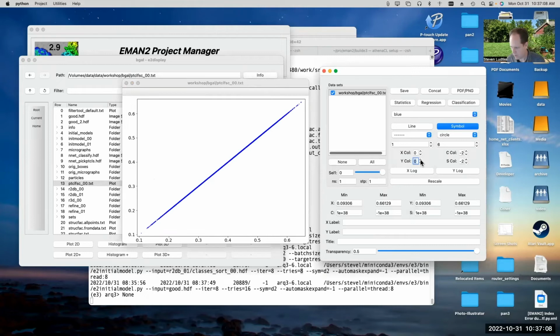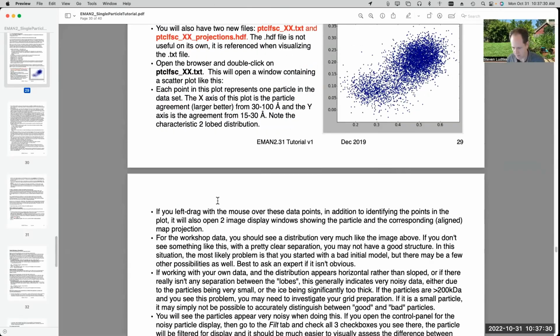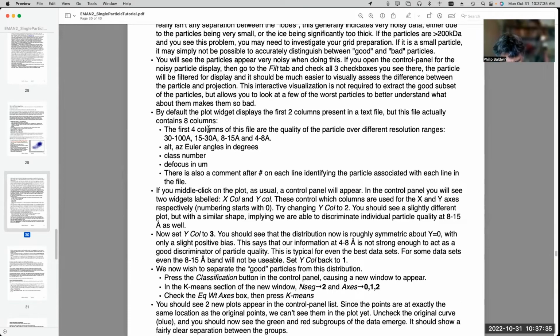The first value is the Fourier shell correlation at low resolution between the particle and the corresponding projection for each particle. The second column is one notch higher resolution, and the third column is another notch higher, and then the fourth column is another notch higher resolution. I think it describes that here somewhere. Yeah, here. So the first four columns are 30 to 100 angstrom resolution, 15 to 30, 8 to 15, and 4 to 8.